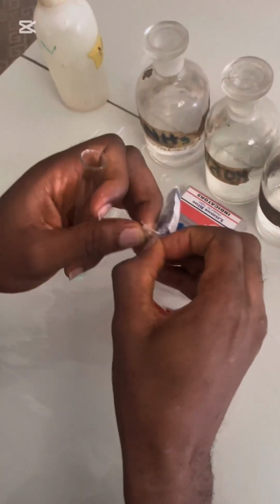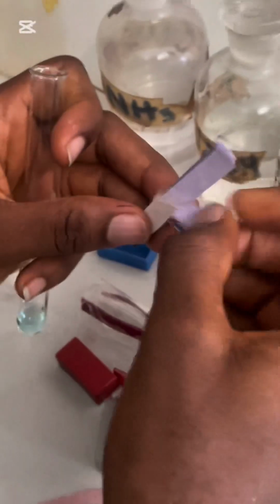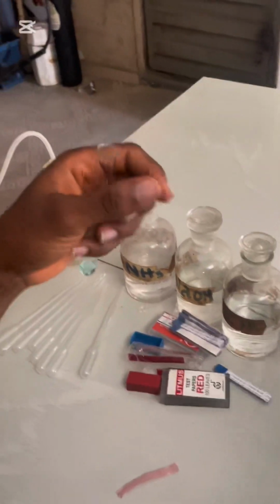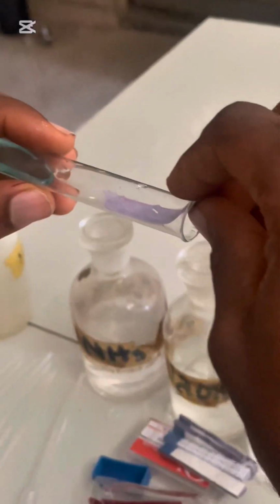Make sure that the video is showing, because it might stop working and you will not know. So I'll check with both red and blue. I would add my blue to this. I'll try it here since I have more portion of the solution.